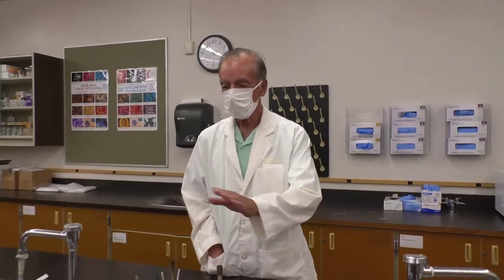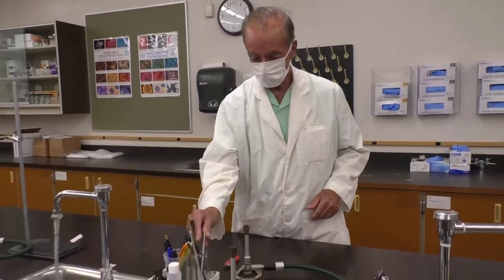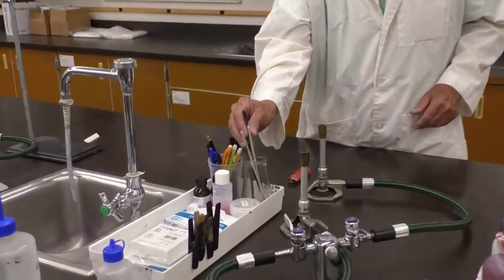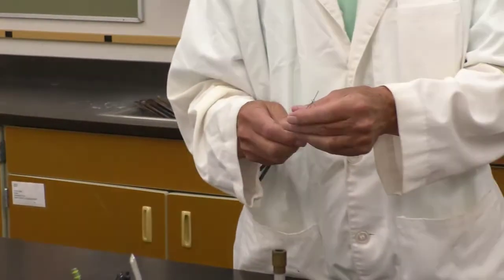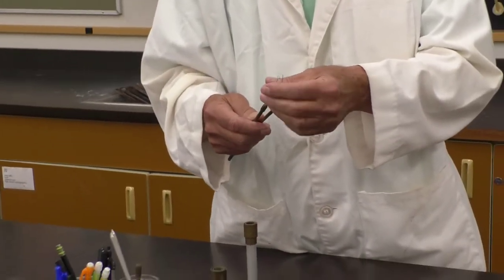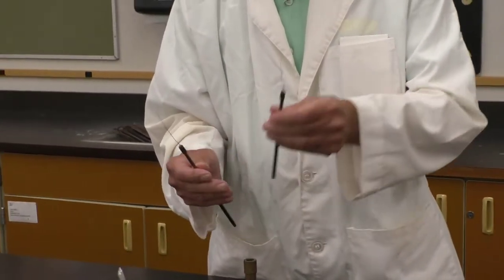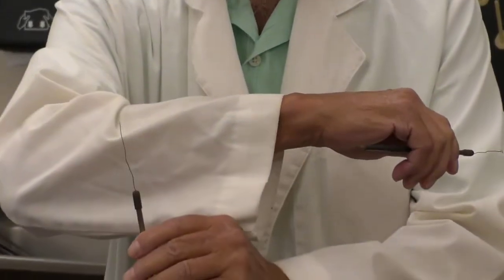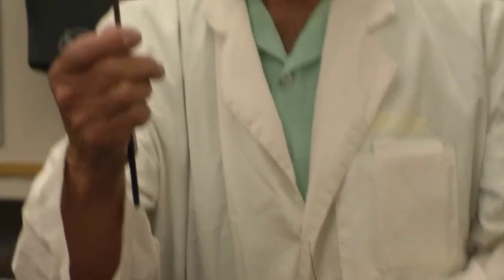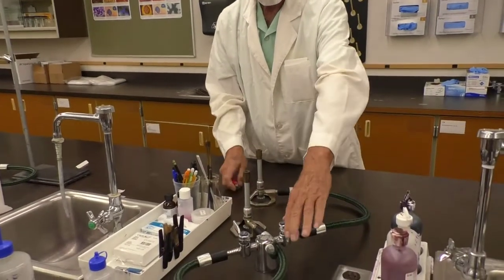So, just to orient yourself with respect to the laboratory, one of the most noticeable things are the inoculating instruments that we use to transfer bacteria. We'll be viewing a number of videos. There are two types of inoculating instruments: the inoculating needle, which has a fine point, you can see, and the inoculating loop. We will use both of these throughout the laboratory.